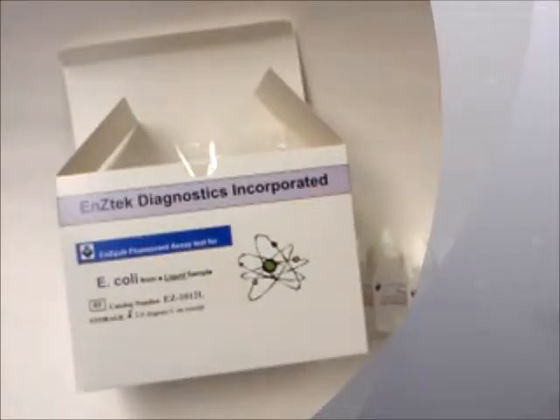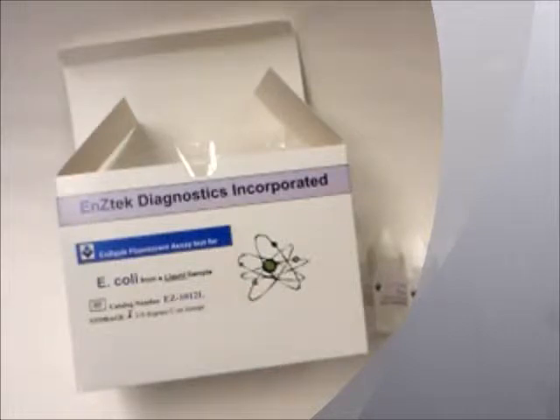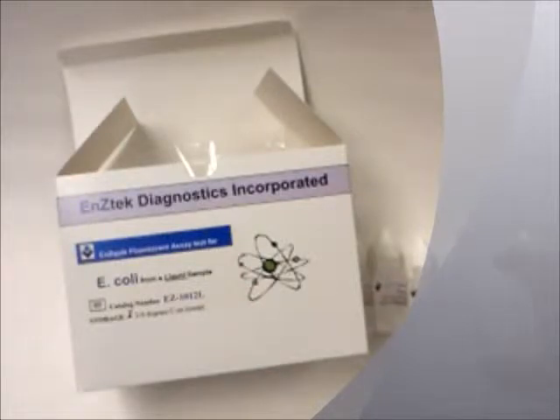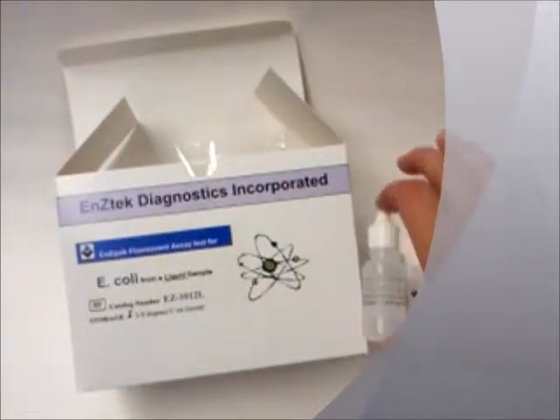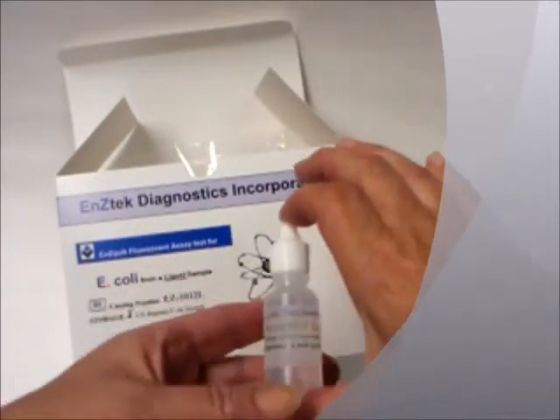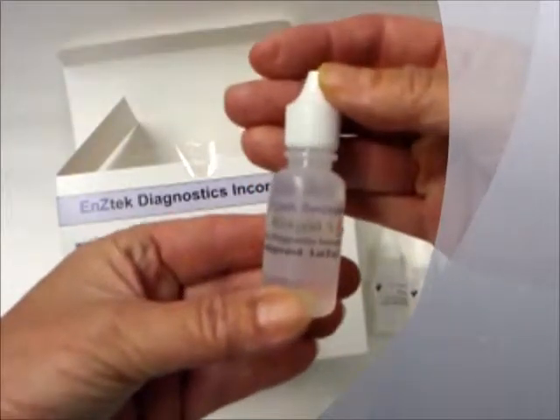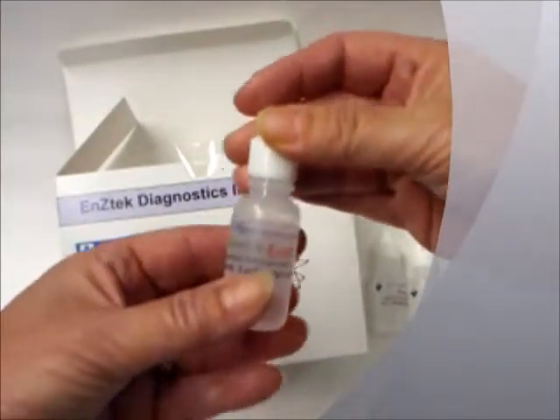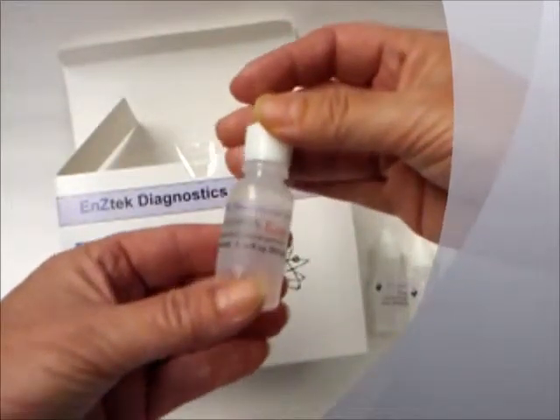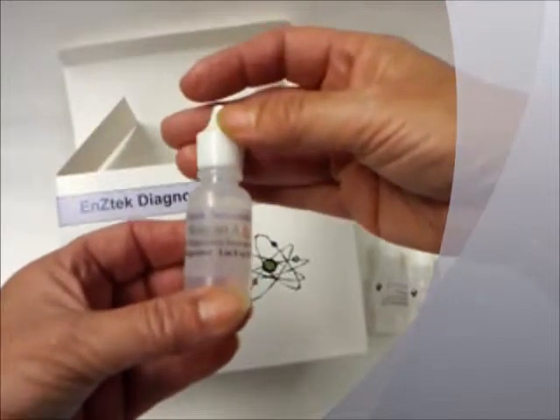The contents of the kit are 1 bottle of Reagent A, which is the reagent specific for the bacteria you are testing for. For example, if you are using the kit for Salmonella, the Reagent A contained in the kit will detect Salmonella.